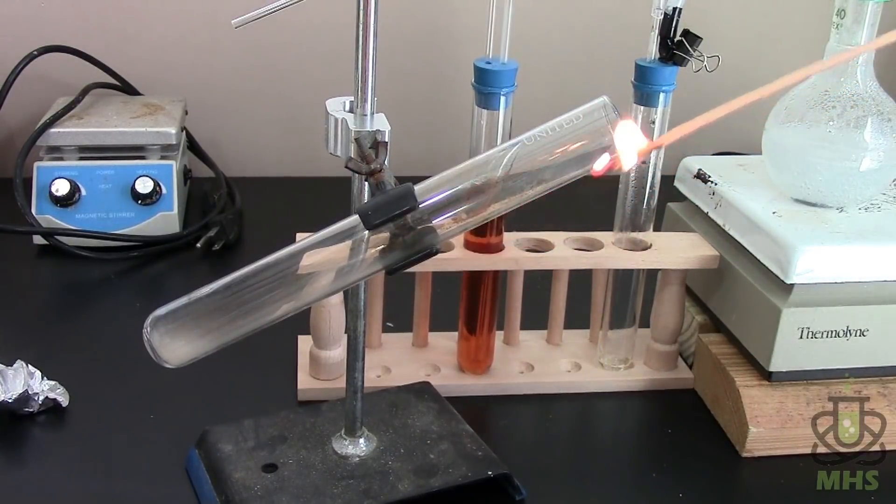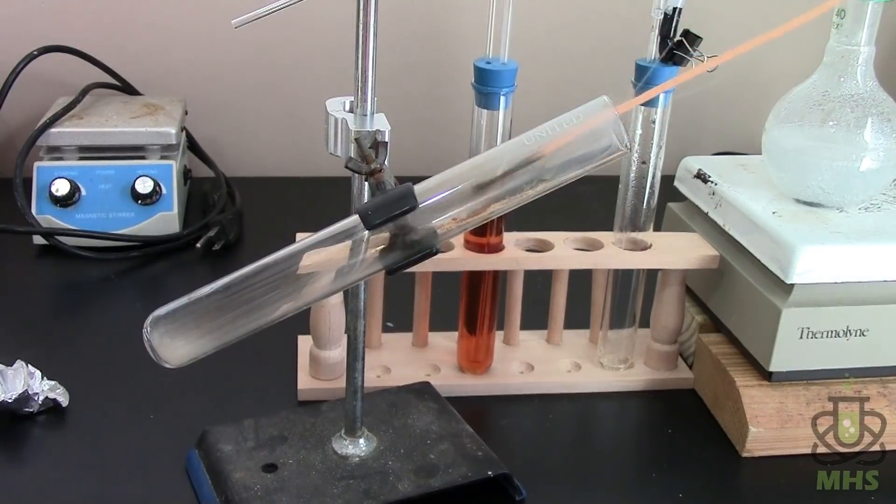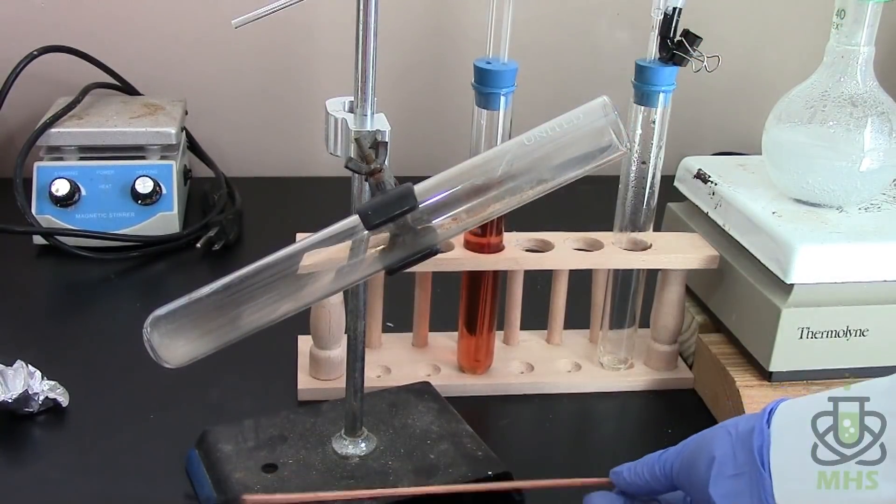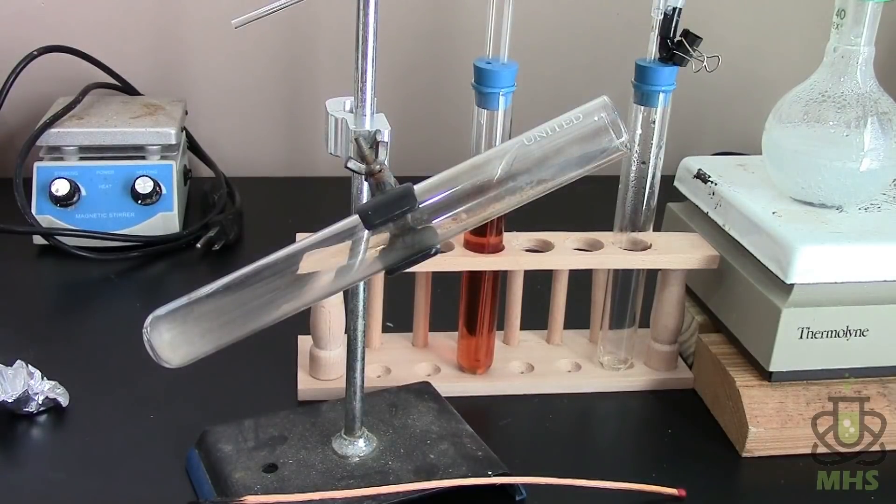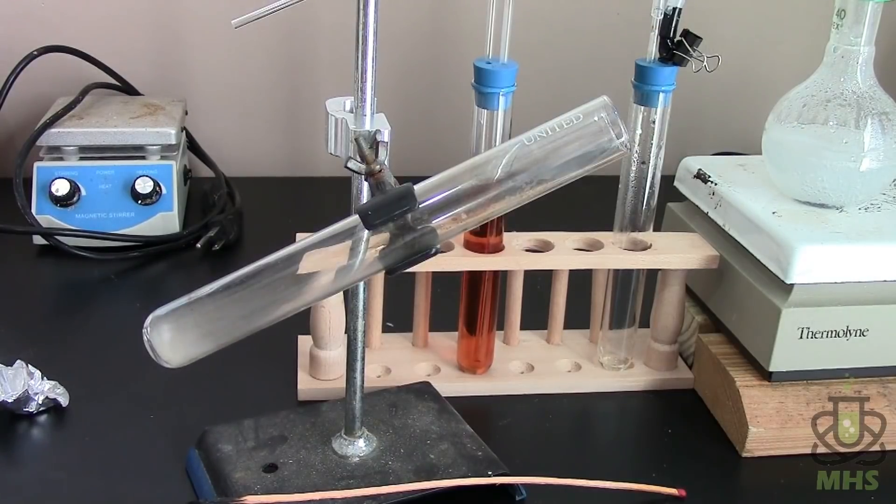So lit splint into the gas gets put out. So that of course is not diagnostic for nitrogen. It doesn't prove that it's nitrogen. It just shows that it doesn't support combustion.